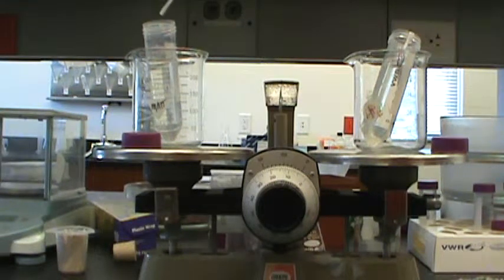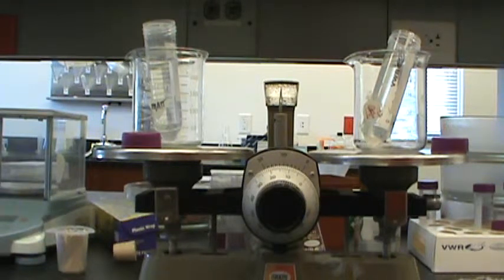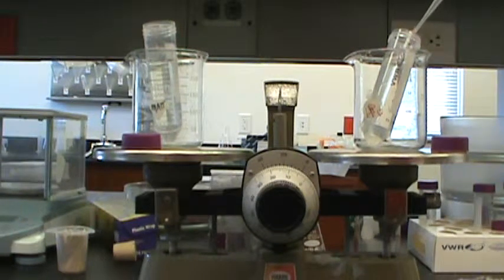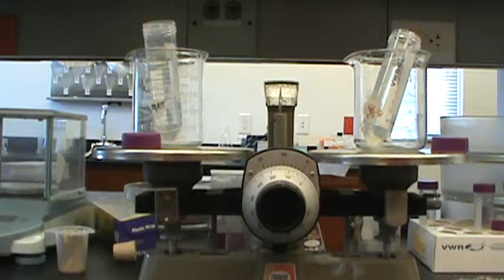Notice that I put the lids on the tubes as well, because if you have one side with a lid and one side without a lid, when you go to put them in the centrifuge, they won't be balanced. Now, this is something that is important to do, but we don't want to spend a lot of time working and working to get it balanced just exactly right. Close will be good enough.